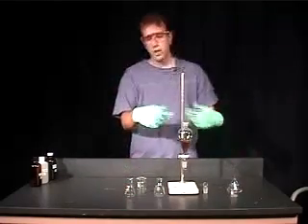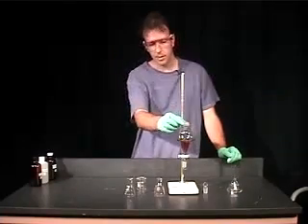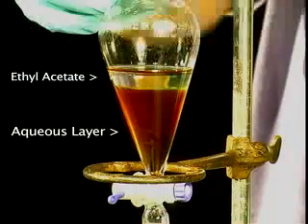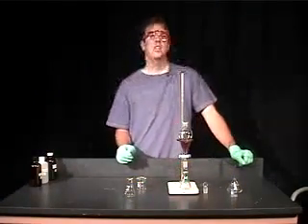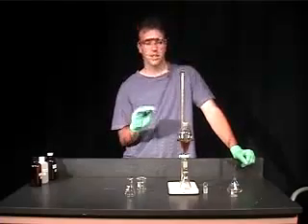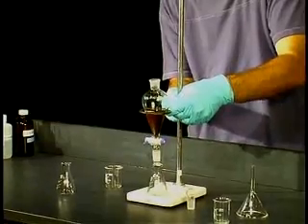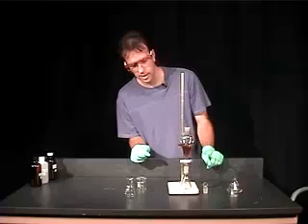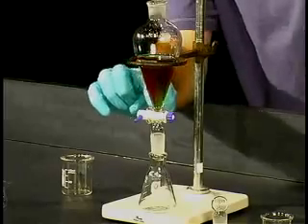When you shake it up, you'll let it sit here until the two layers separate. You can't see it because of the ring here, but I'll pick it up so you can see the two layers. Once they have separated well enough, I'm going to put our collecting flask underneath. The aqueous layer is more dense than ethyl acetate, so it's the bottom layer. I'm going to lower this just a little bit so we can get this over the Erlenmeyer, our collecting flask. Now you simply want to open the stopcock until you have the interface just at the level of the stopcock.